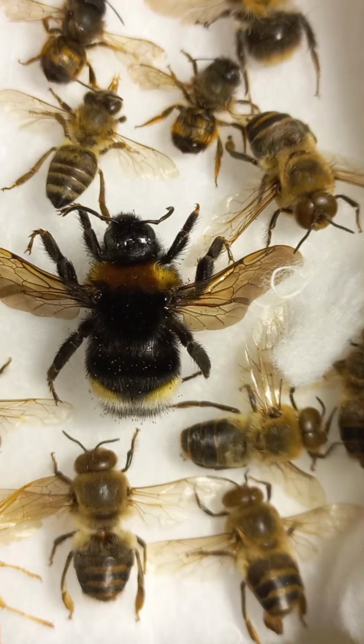What about wings of honeybees and solitary bees? There are 4 wings on honeybees. The 4 wings of bees are designed to fold together over the abdomen while the bee is inside the colony. But for better stability during flight, the wings are held horizontally and hooked together with a special wing hook, which is called hamuli, or just one hamulus. Wing veins help keep the wings rigid and supply blood, or hemolymph.